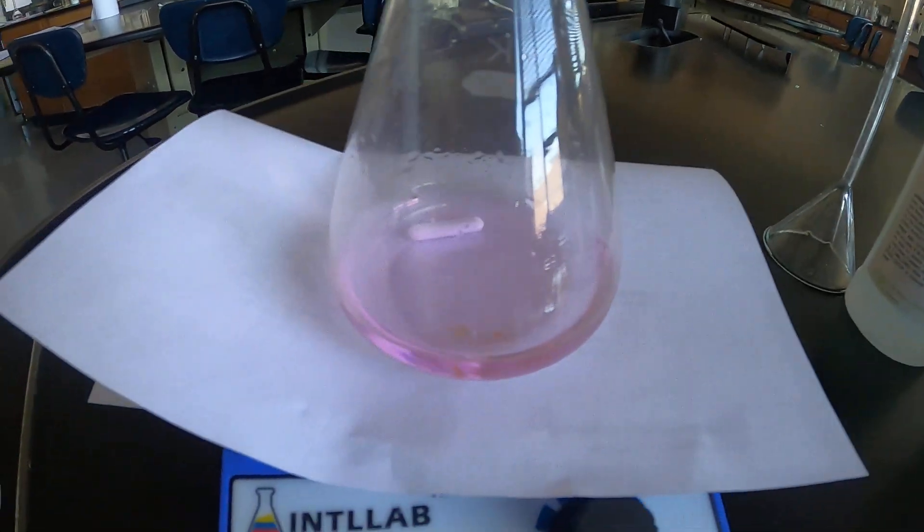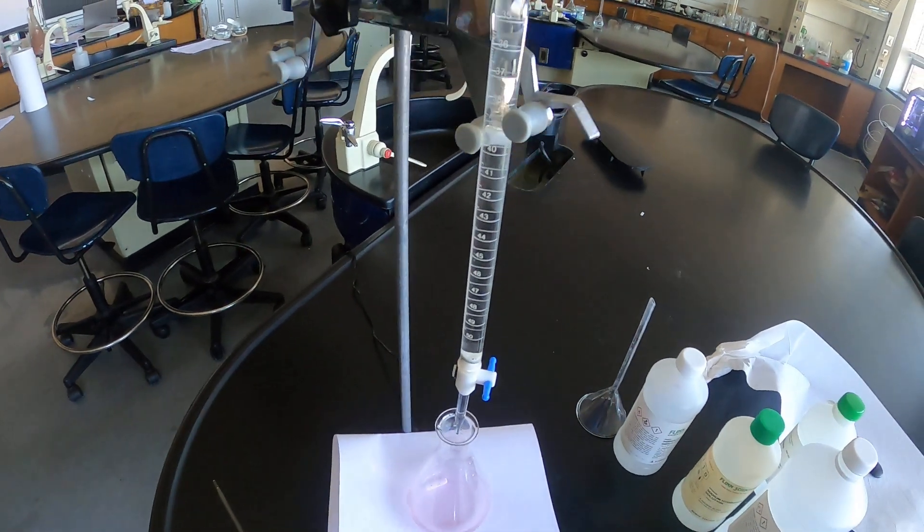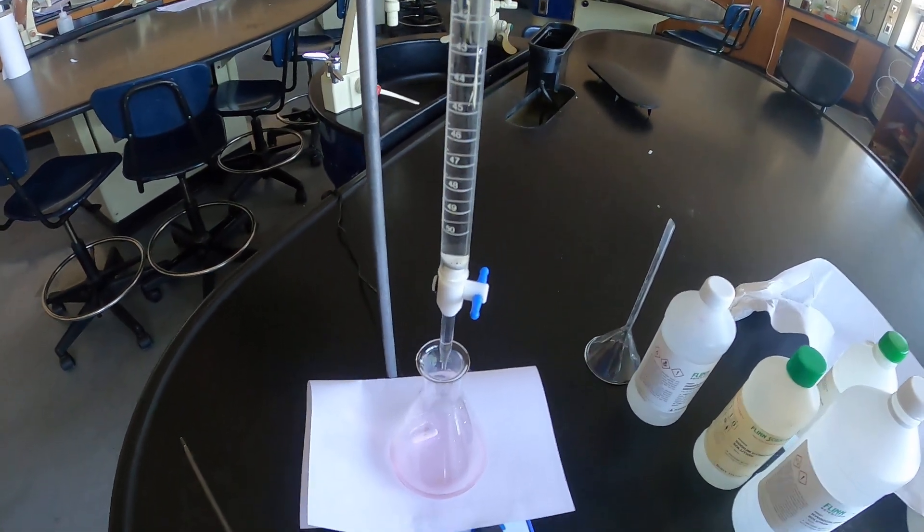That titration is done. The pink color has still withstood, it's a faint pink but it is definitely still there and you are going to run this experiment in triplicate. Try and reach a low percent error. That's all I got for you, good luck on the lab.